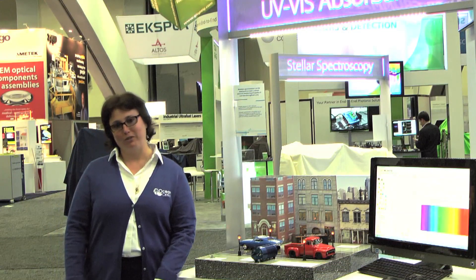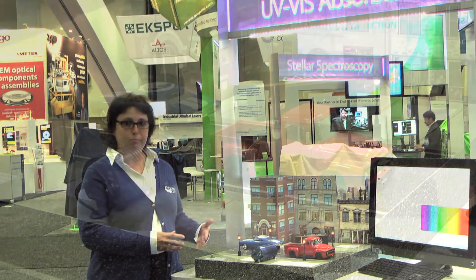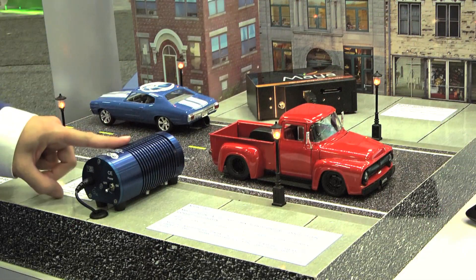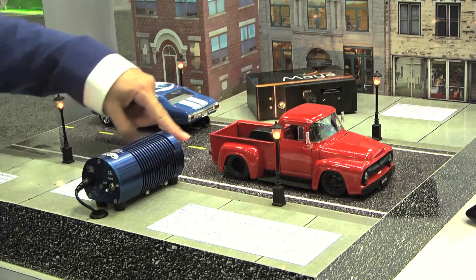One of the benefits of modular spectroscopy is that you can take your measurement to your sample. One application where this is particularly important is if you want to make real-time measurements of air quality. In this example, we're using a Maya 2000 Pro and an HL2000 light source to make a transmission measurement across a busy road.